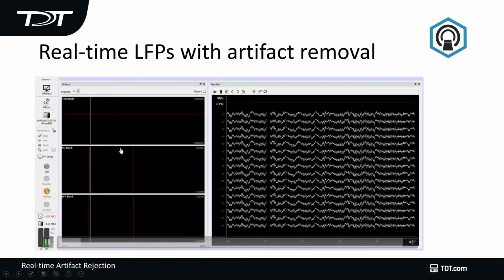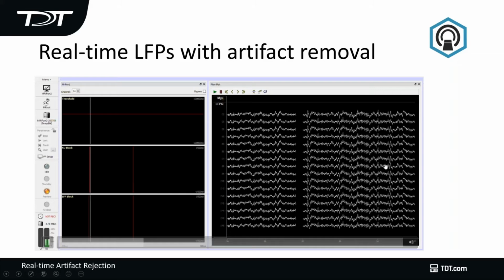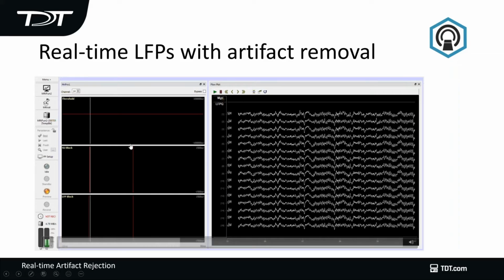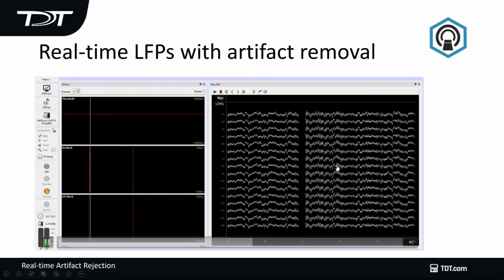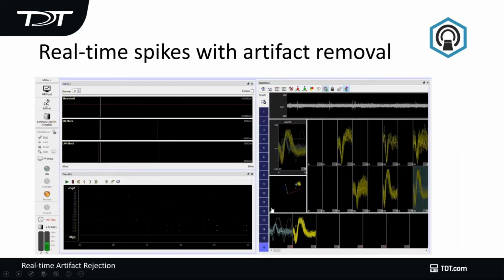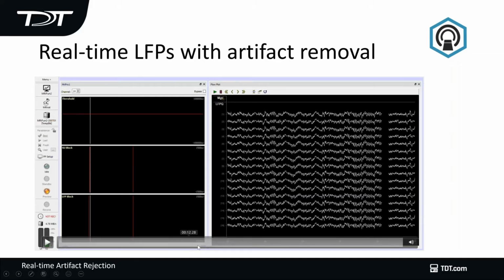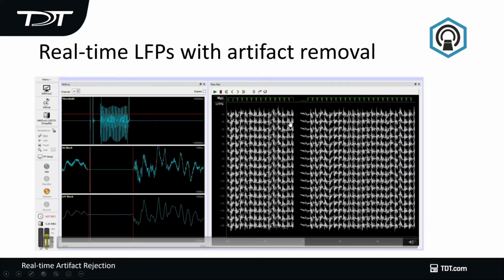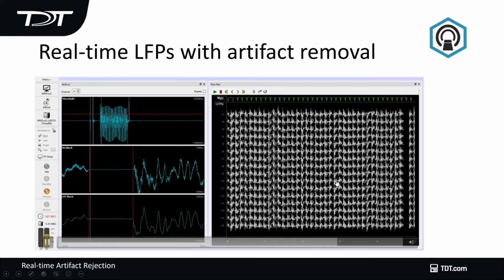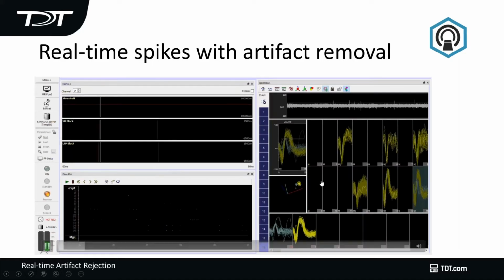On the other hand, if I use my MRI Artifact Rejection Gizmo, this is going to allow me to detect and remove that signal from the recording. It should come up in a second. Here, sorry. And you can see some of the signal. It's not great, but you can also detect some of the waveforms within that. You get a better response if you're looking at spiking activity.